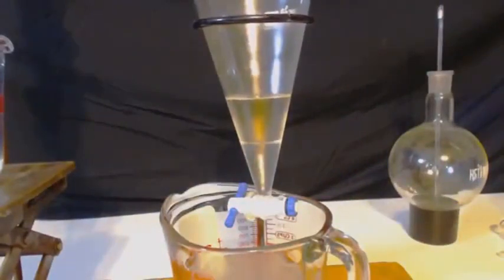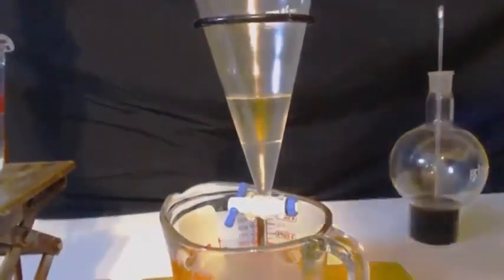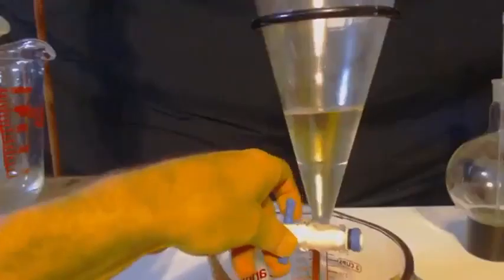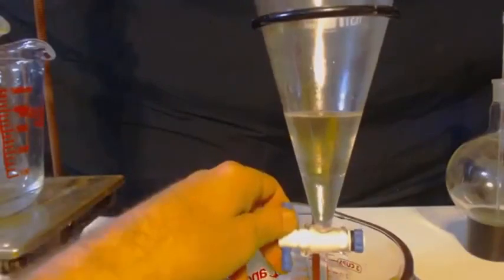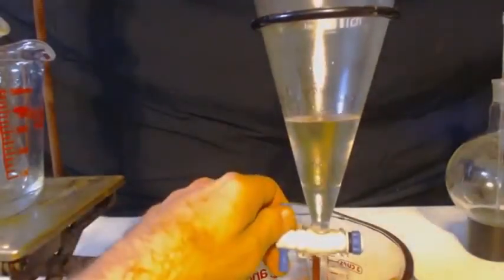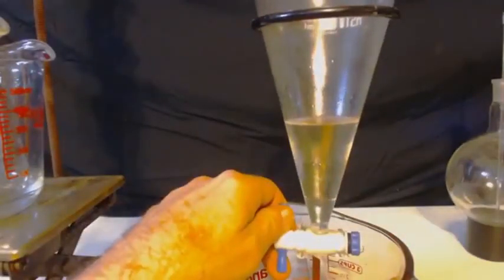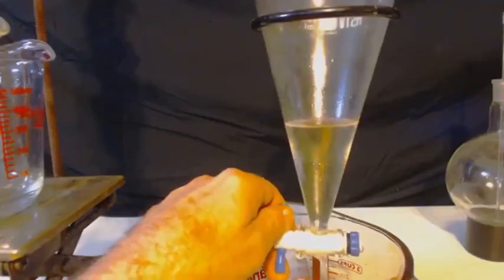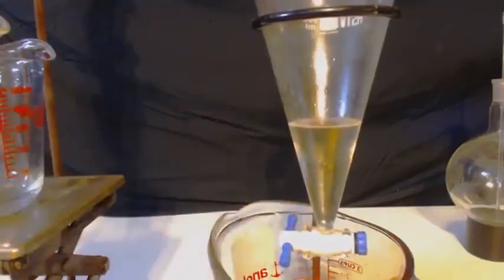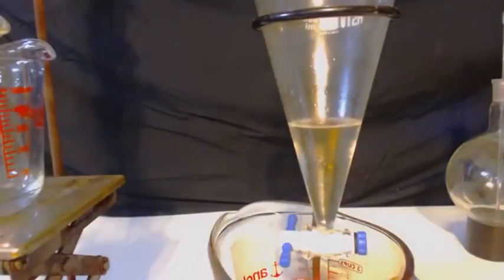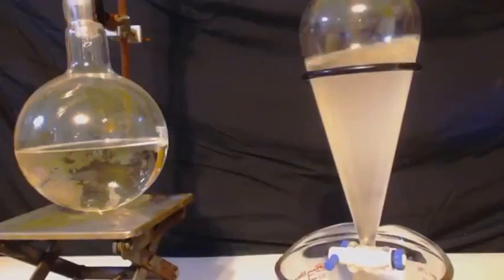Half of what is in there, half of that bottom layer is probably acetone. It was stuck inside there. So I'm going to shake it up, let it sit for a while, and drain it out, and then I will have half of the can, just the hydrocarbons of it. I will set that aside, because I still got to do the other half of the can.